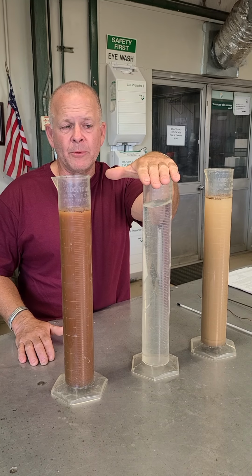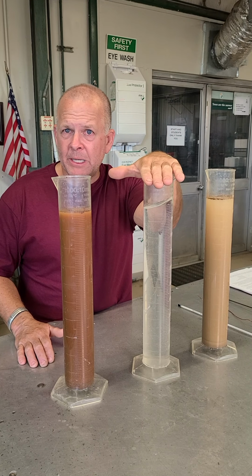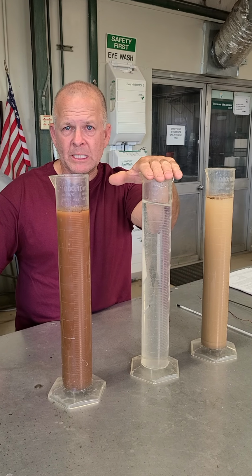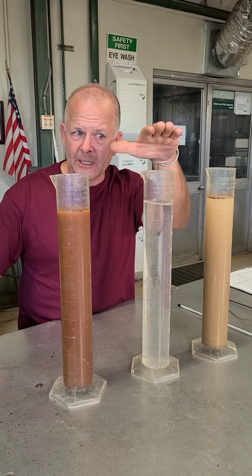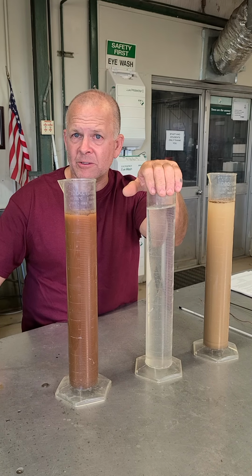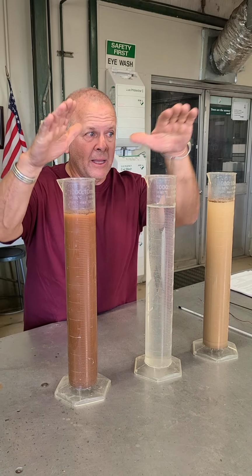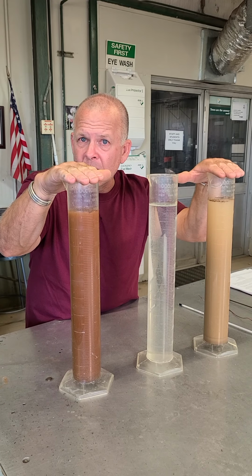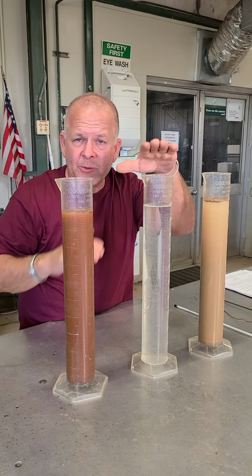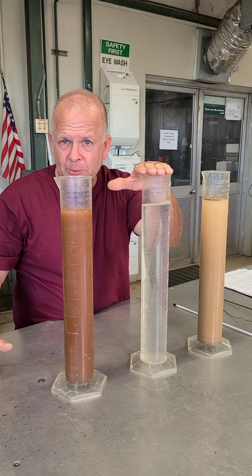What's up with this sample? Well, there's going to be an error associated with every experiment, correct? So what we've done with this particular clear sample, this is our blank. Now what is a blank? A blank is basically going to catch our errors, whatever errors we might have, whether we got some contamination in our water or something like that. This one should pick it up. That's what we're going to use this one for.